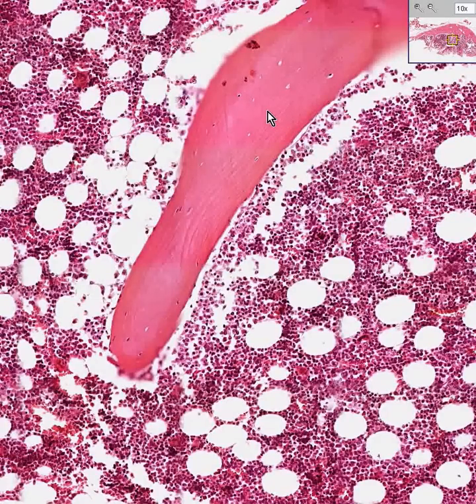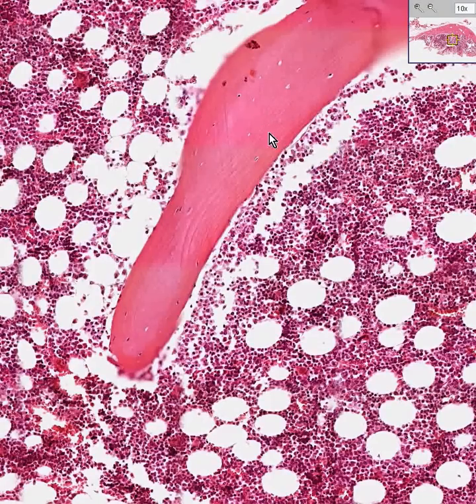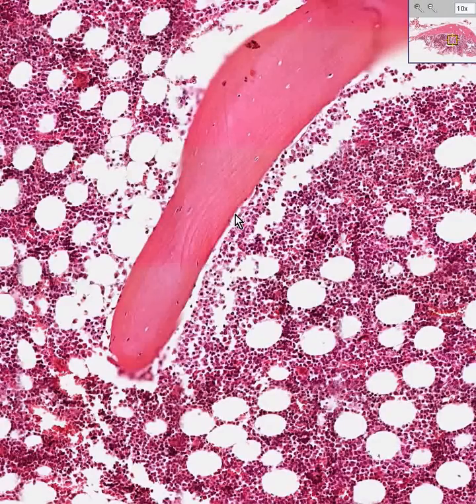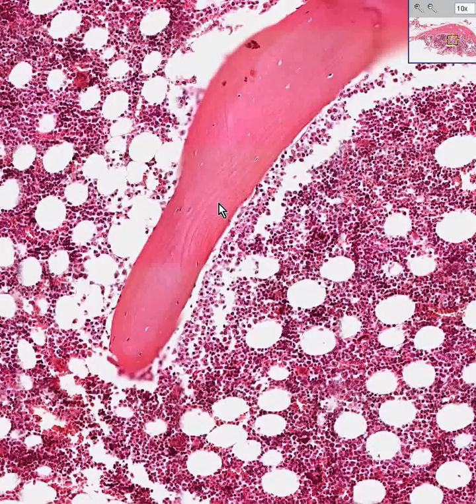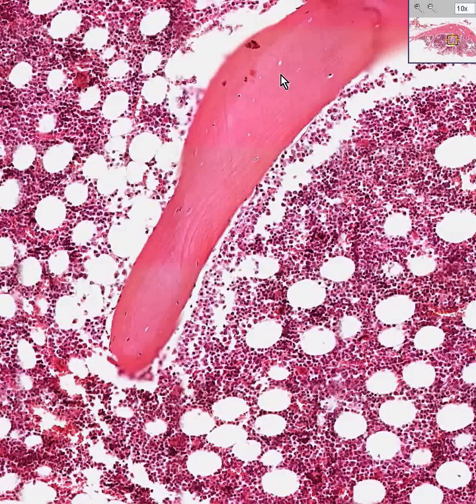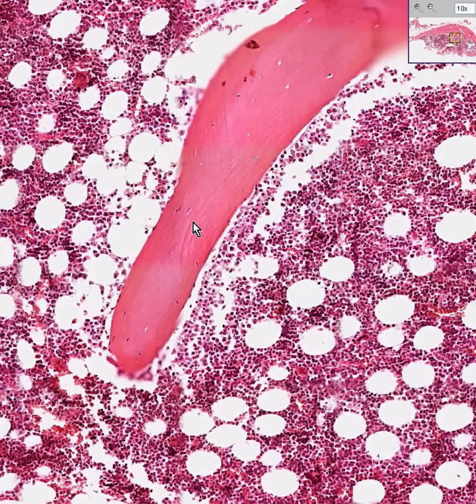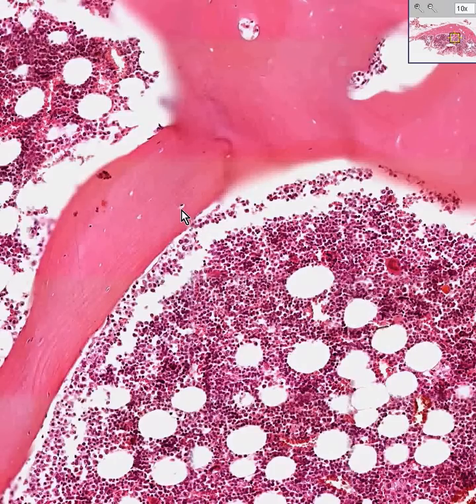The membranous bone, spicular bone, cancellous bone, or spongy bone is formed by osteoblasts appearing at the periphery of these spicules and then being trapped within the spicule in a lamellar fashion. That is why you do not see Haversian canals and Volkmann's canals — you see a more concentric or lamellar deposition of bone. You have these rims of osteoblasts on the outside of the spicule, and as it grows, these osteoblasts get trapped within the middle of the spicule to become osteocytes.